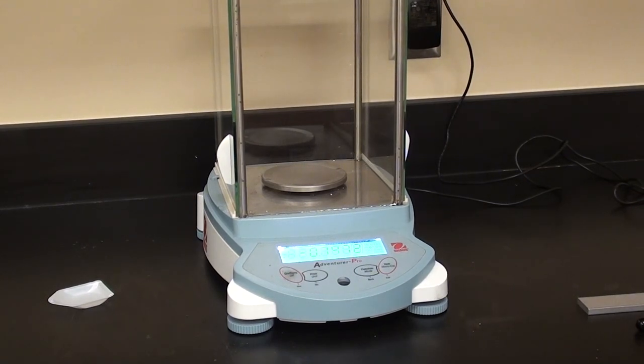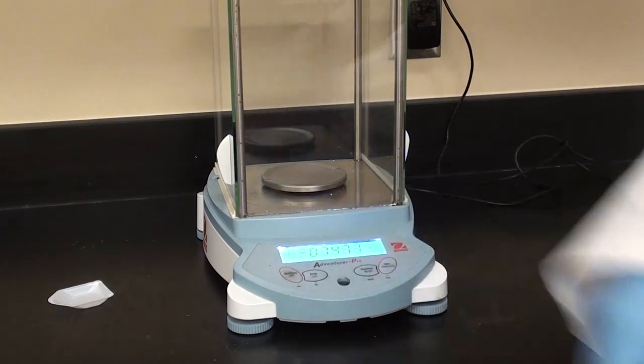The kind of balance we're going to use to weigh this doesn't really matter, it depends on what your instructor has available at the time. We're going to use an analytical balance. So let's go ahead and tare it out, put a zero, zero it.